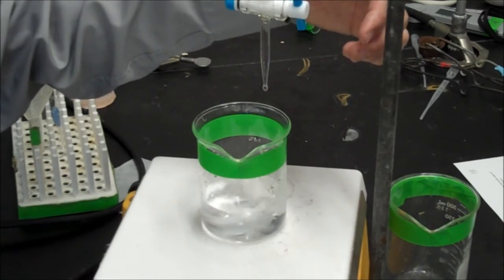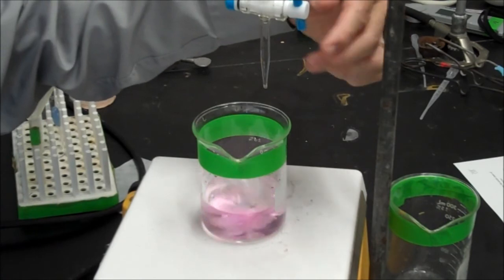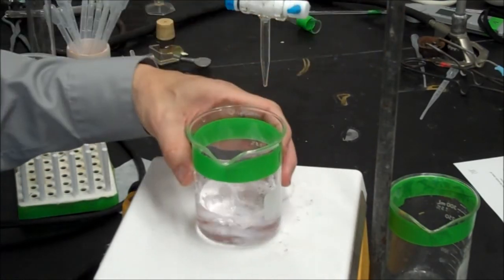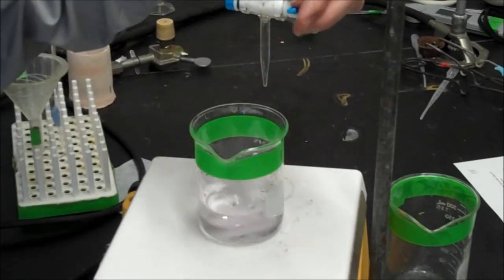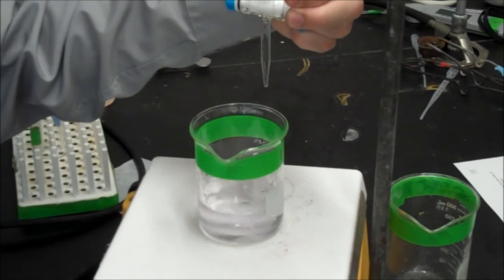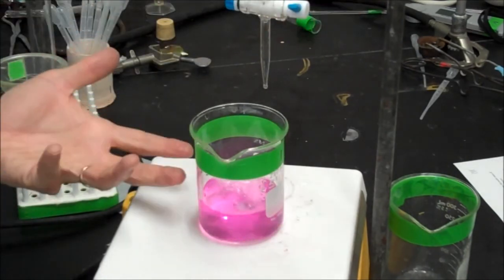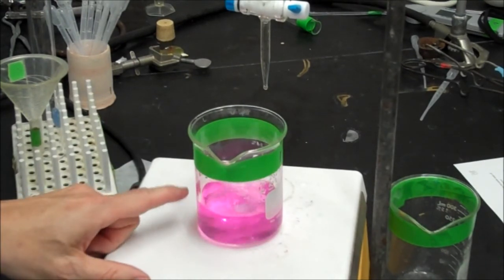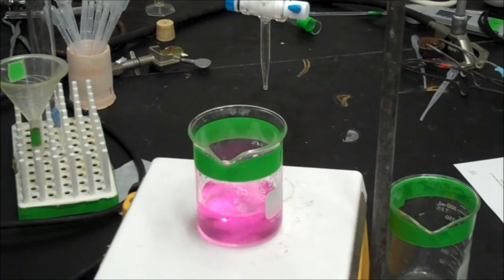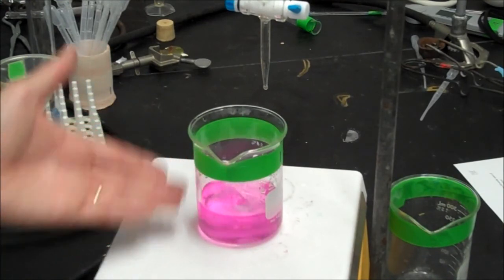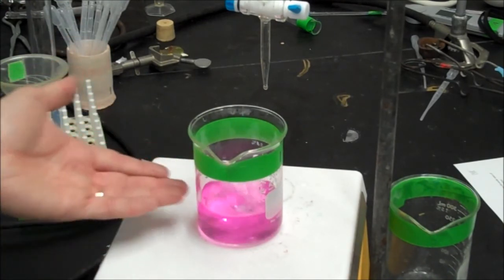I'm guessing this is it. And maybe I want to add one drop more. One drop more. Let's see. I added two drops and you can see I went too far. I've added a little bit too much base. I didn't have enough skill there with turning it off after one drop. But you can see it's pink. It's permanently pink. I have neutralized all the acid molecules. I've reacted them all with base.